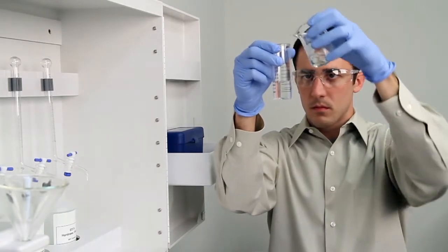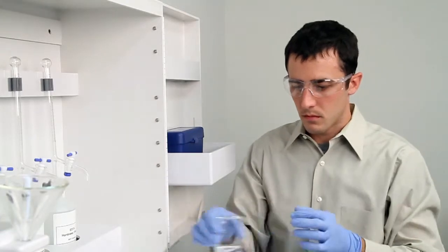Once you feel you have an accurate sample, place the vial on a level surface and bend down to eye level to verify.